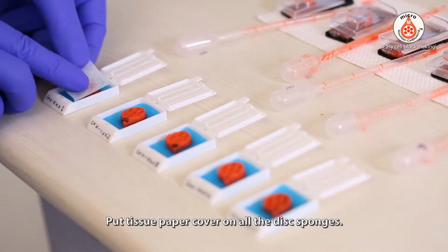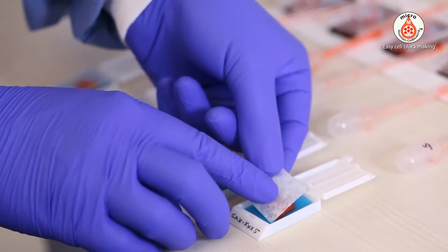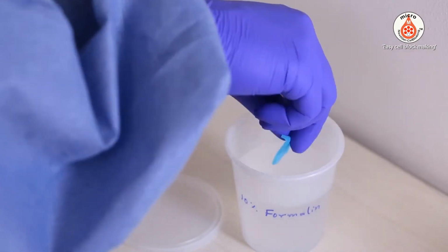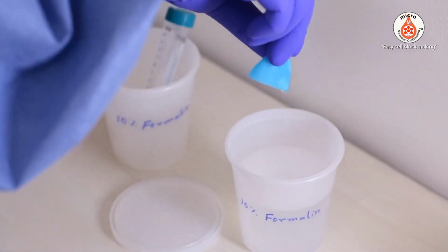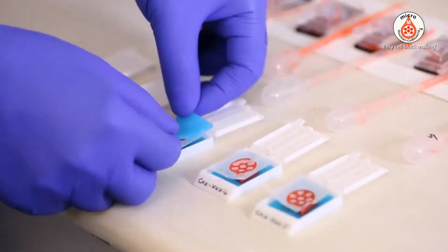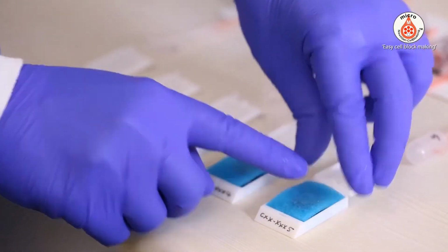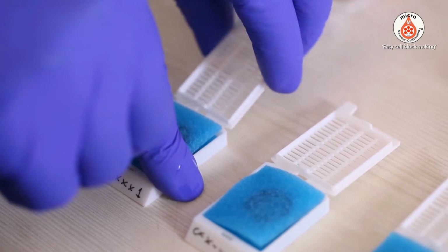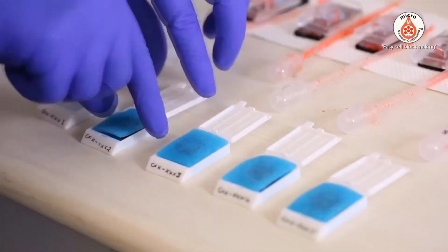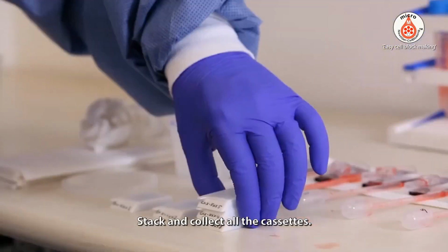Put tissue paper cover on all the disc sponges. Place the second tissue sponge, moistened with 10% formalin. Snap close the lid of the tissue cassette. Stack and collect all the cassettes.